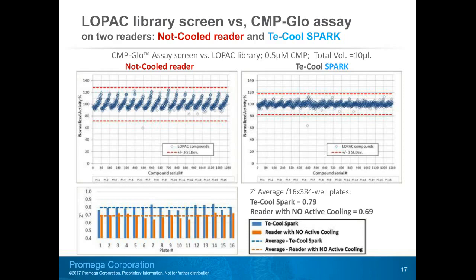Now let's look at CMP-Glo assay versus LOPAC screen data. On the left graph, data were collected on the not cooled reader, and on the right graph, results were obtained on the T-cool Spark reader. As you see, T-cool results appear significantly smoother. By calculating Z prime values for each plate, you can see the signal difference between not cooled and actively cooled readers.